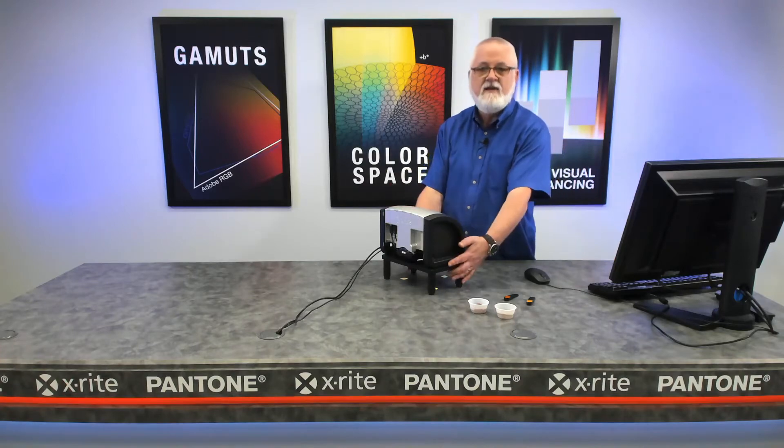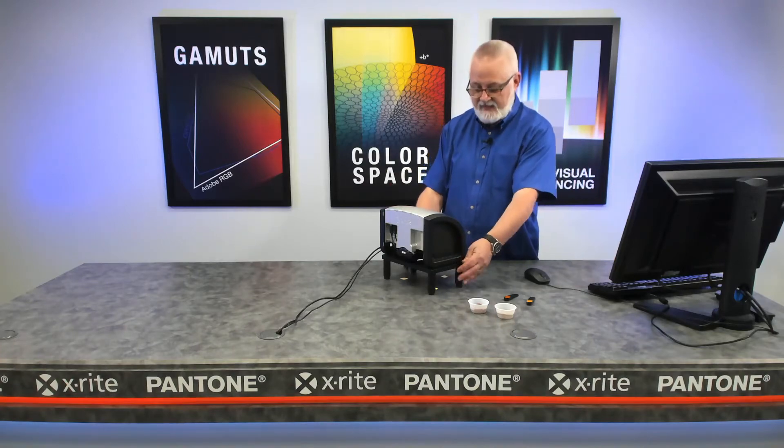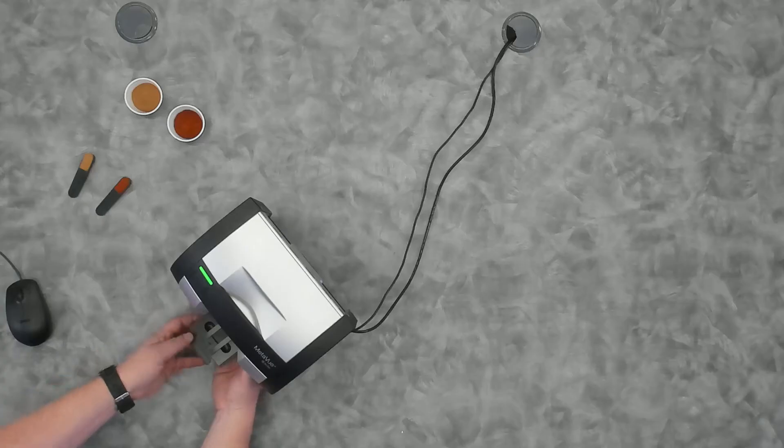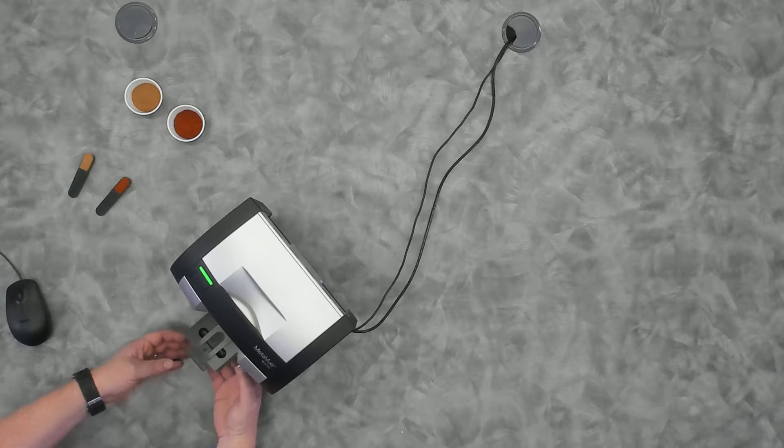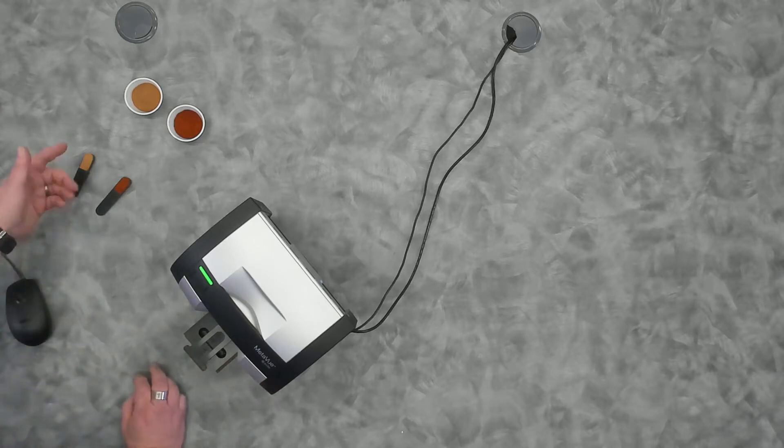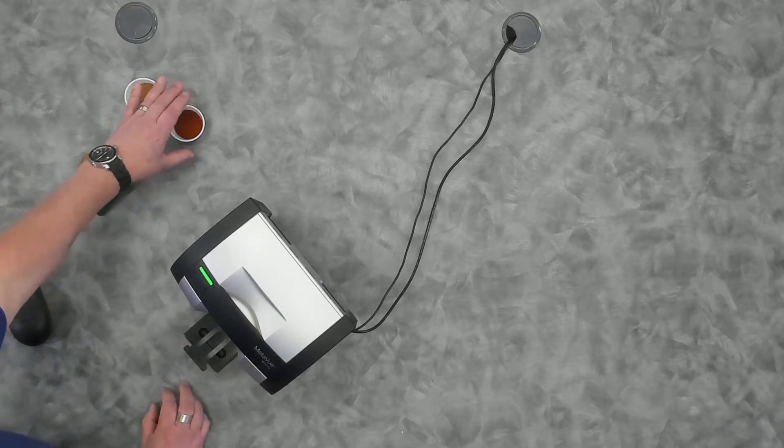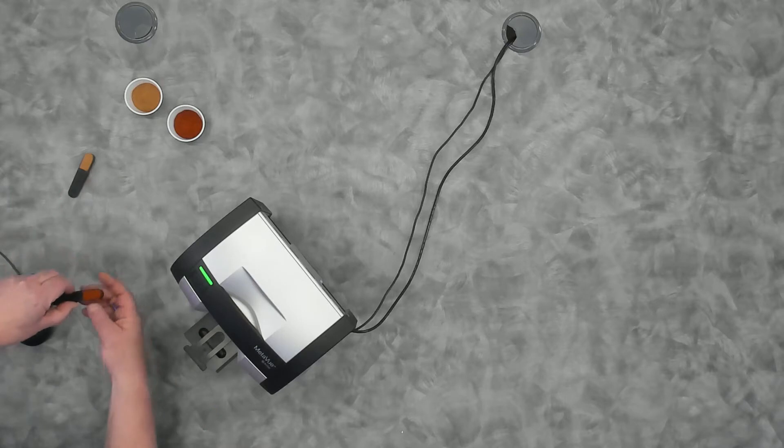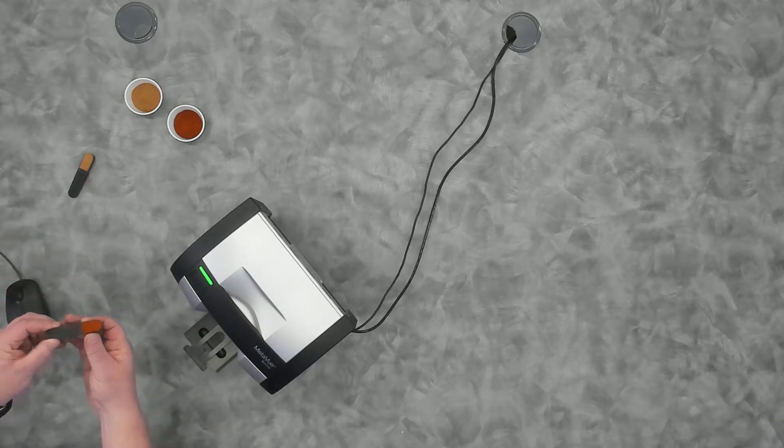It's in a stand, and this stand has in it a drawer, and this drawer slides in and out. You can see I've got some powders here. This happens to be paprika that I've already loaded into this little spoon that comes with the stand.